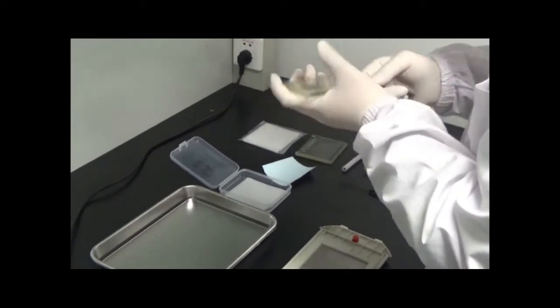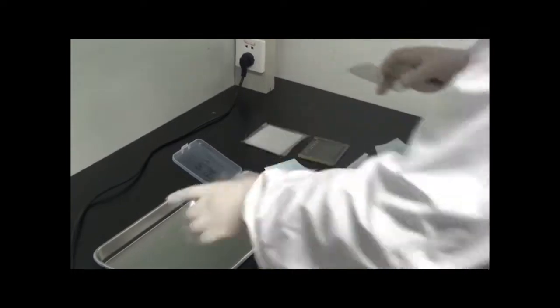Open the gel using the cassette opening tool. Then, place the gel in water.